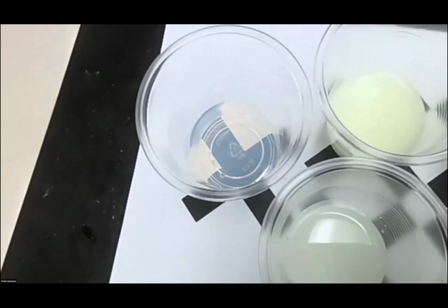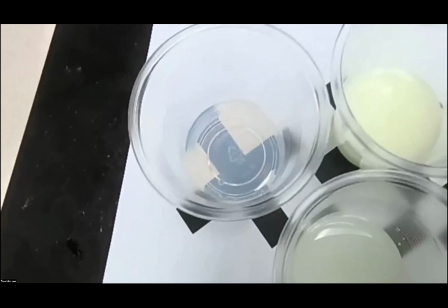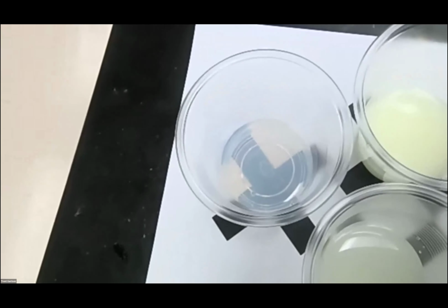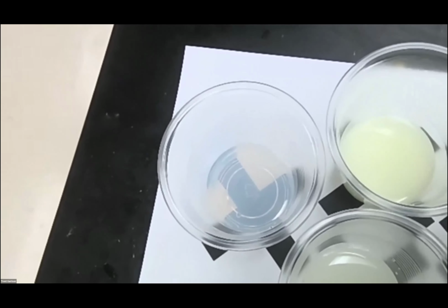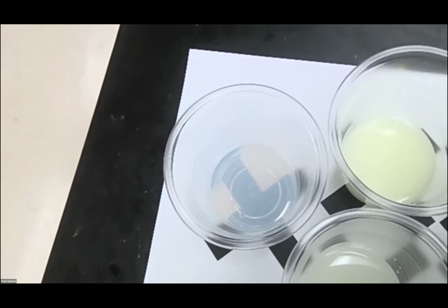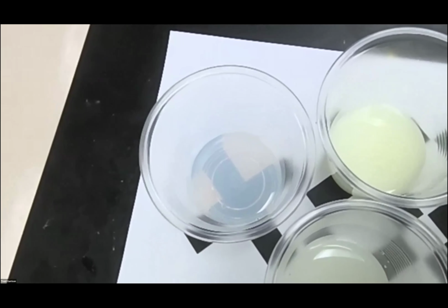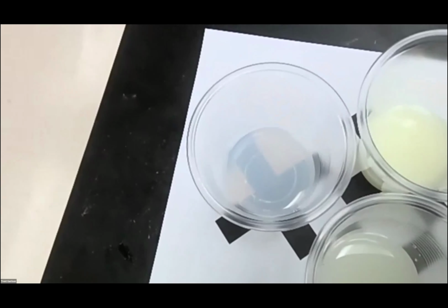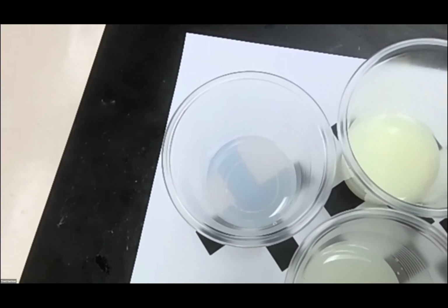So here we go. It is starting to get darker, or it's starting to get obscured. We are at 1:40. It's slow. So I'm glad that we at least fast forwarded a little bit for you so that you can see the process and not so painfully so. All right. We're at 1:50. So it's going to take over 2 minutes for this to finally occur.